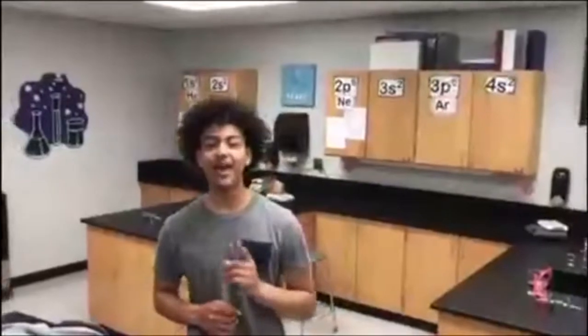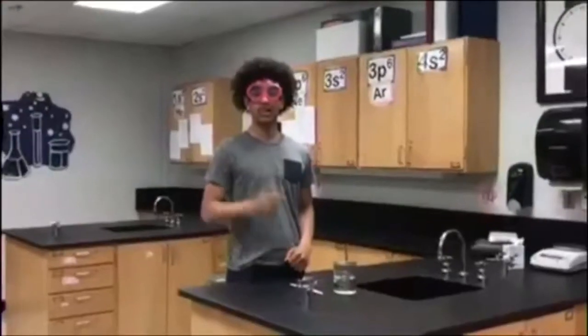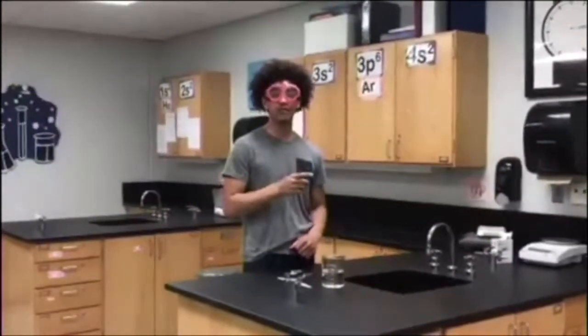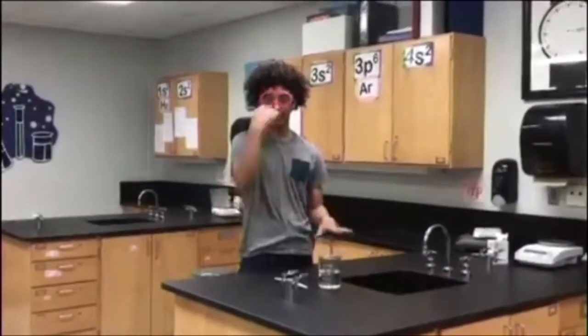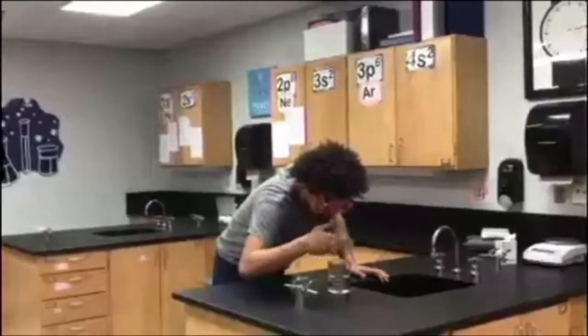All right, guys. Now, here's a bad example of wafting. All right, guys. Now, this is how you properly waft a chemical that you don't want to get into your lungs. And it can maybe kill you.